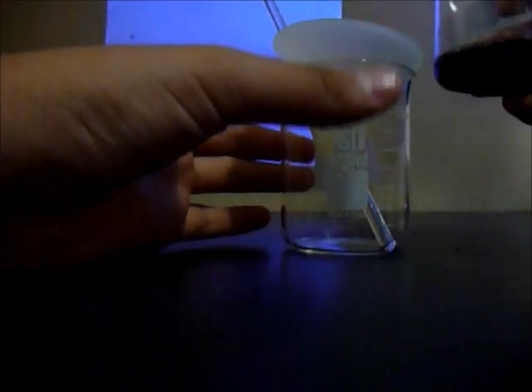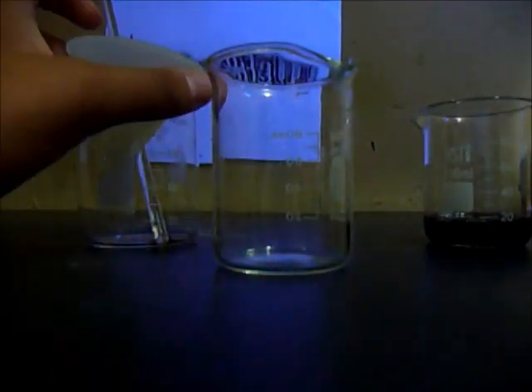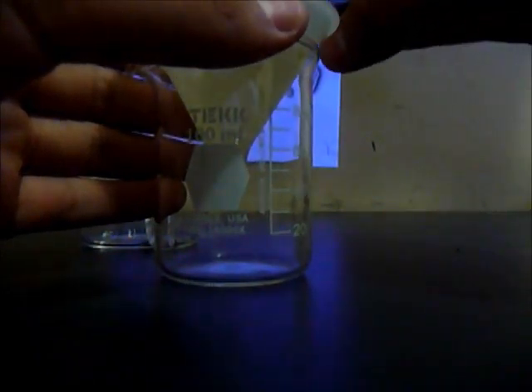And now filter with the filter. So get your filter setup and pour everything. No, not in here. In the different beaker.